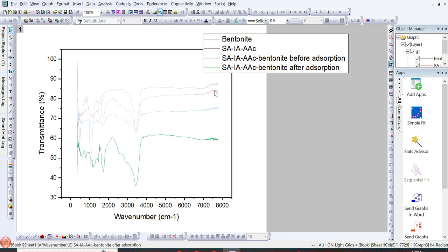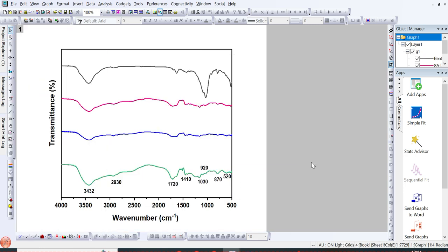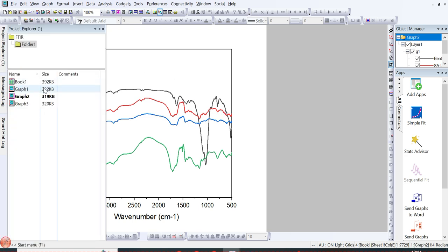But the main issue that students generally face is how they can remove this overlapping trend. So for example, if I show you a graph like this, here you can see in some journals, in some published papers like in ACS and other journals, the FTIR and XRD data is very clear with equal line spacing between the data points, and this is very important to differentiate between the required wave numbers or data points, and it looks more reasonable and attractive when we compare it with this overlapping spectra. So let's get started on learning how you can remove this overlapping trend from your FTIR spectra.